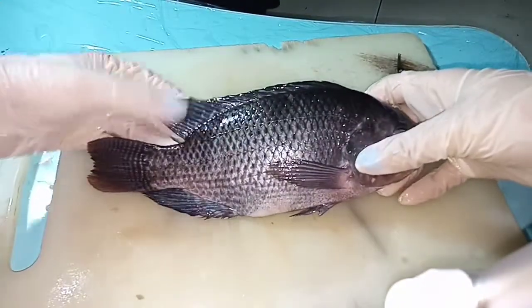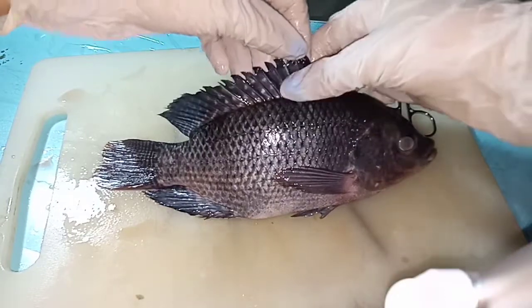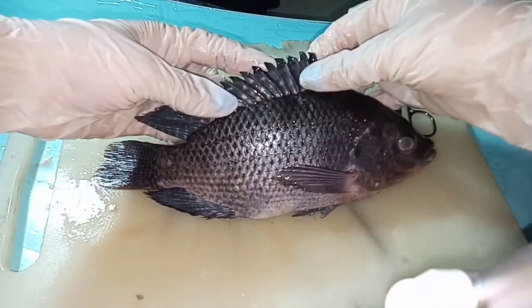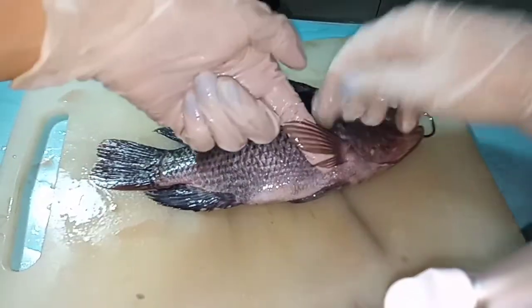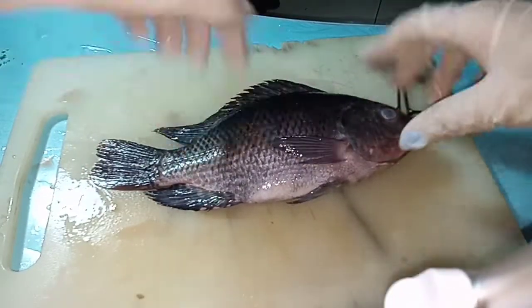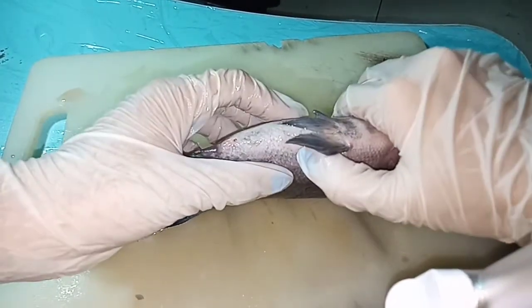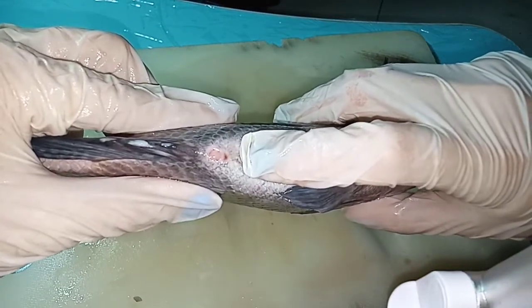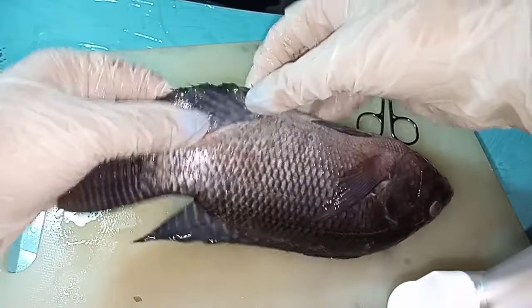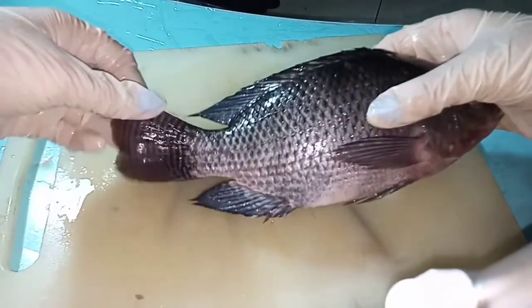Here are the gills. In the trunk region, we could see the spiny dorsal fins. We could clearly see the smooth dorsal fin and the bony dorsal fin. This is the pectoral fin. This is the pelvic fin. This part is the anus. This is the anal fin. And lastly, the tail region is the caudal fin.